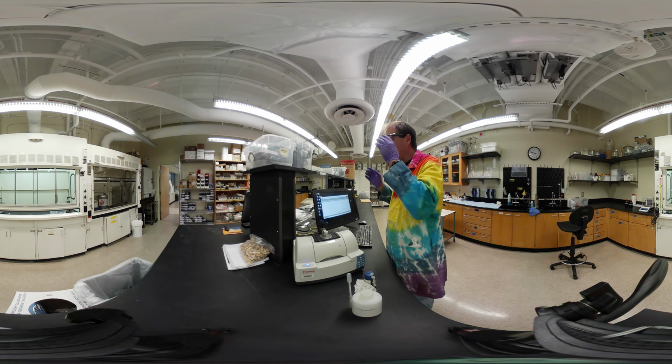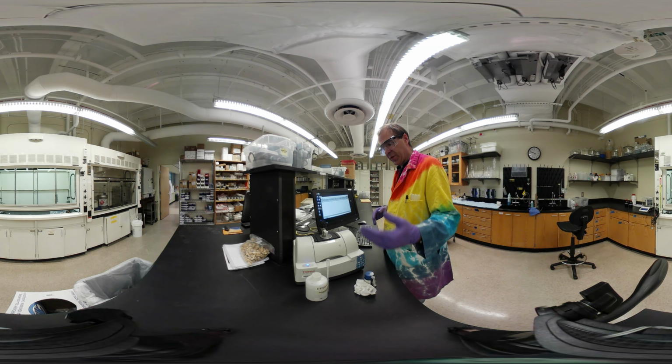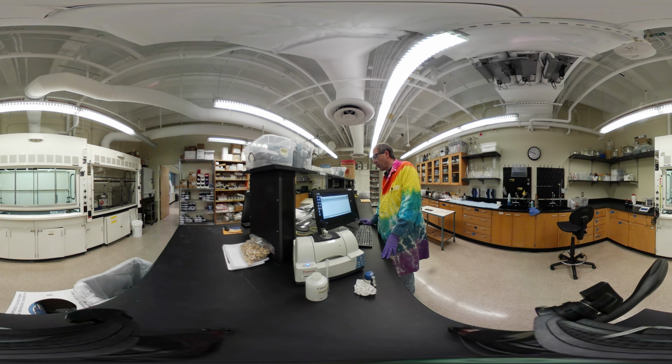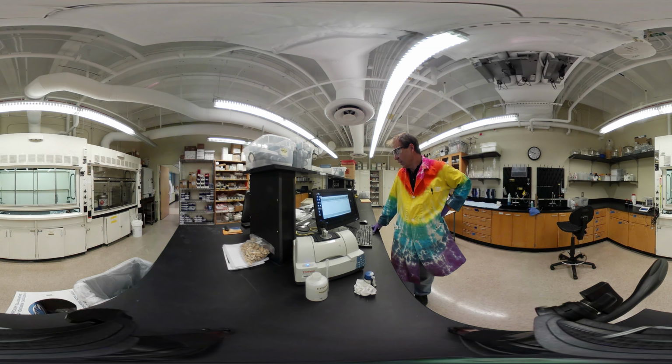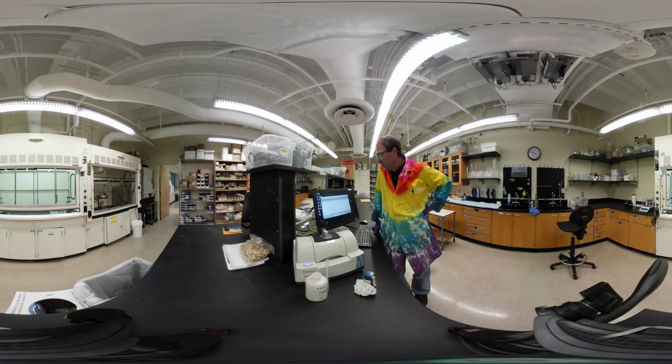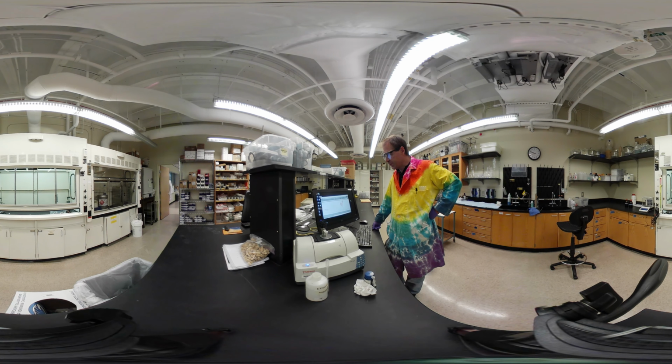Okay, so we're back in the prep room for the second 4 labs, and it's because we have the IR set up. So we're going to do an IR of our starting material and our product. Remember, we always have to do the background. So we're going to go ahead and collect our background here. 16 scans again. It's always a multiple, a factor of 2.